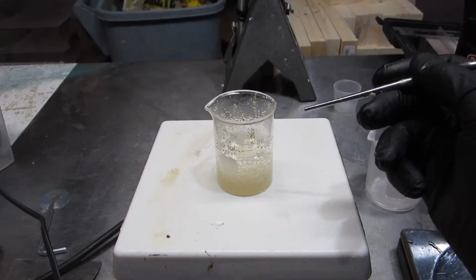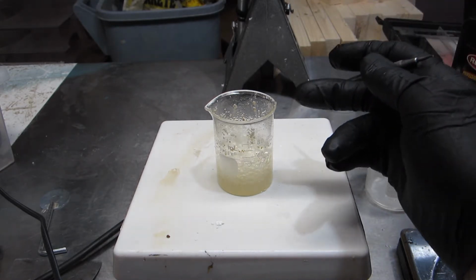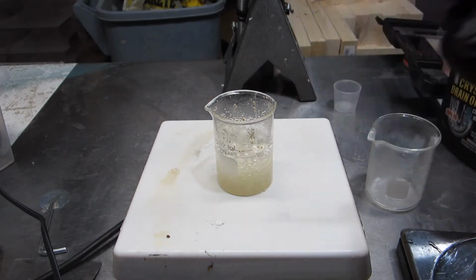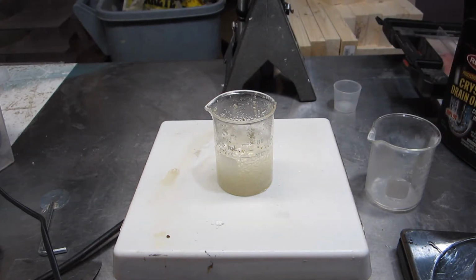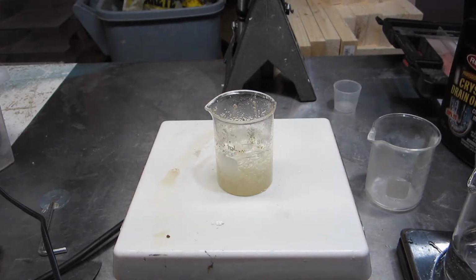Because I don't have a perfectly pure solution here, I obviously have a lot of contamination, it's hard to know when this is completely done. But this has been going for about half an hour now. We've been skimming off the scum that forms on the bubbles. Still doing it a little bit. And it's clarified significantly. I do feel like it's kind of done. But science isn't about feelings, so whether it really is or not is a totally different question. Assuming that it is done, we're going to put it into the water here, and then we should have a solution that we can later use.